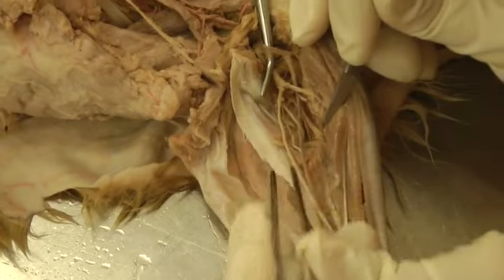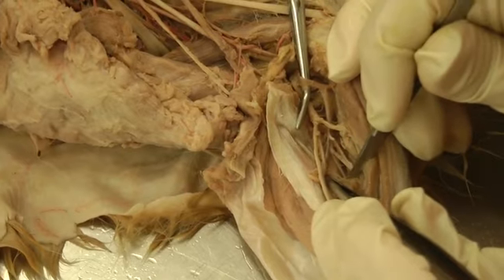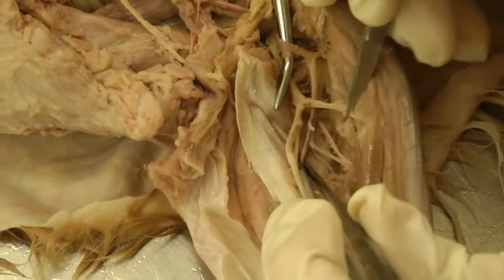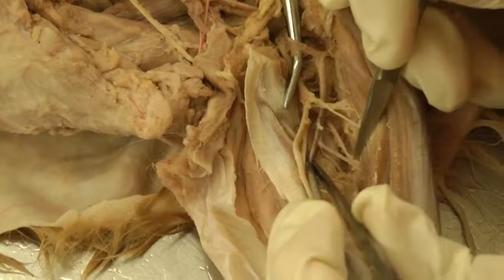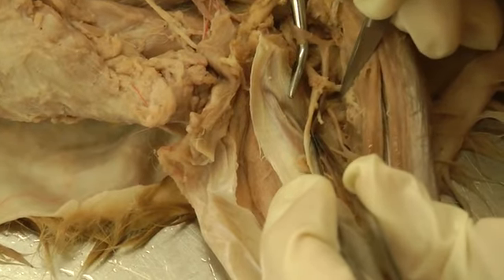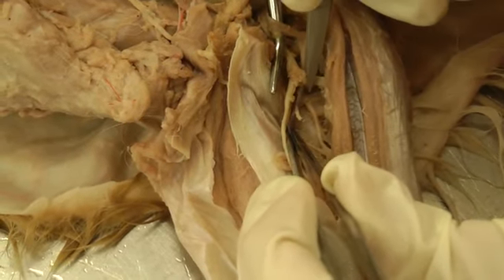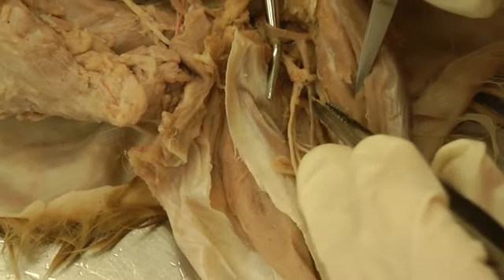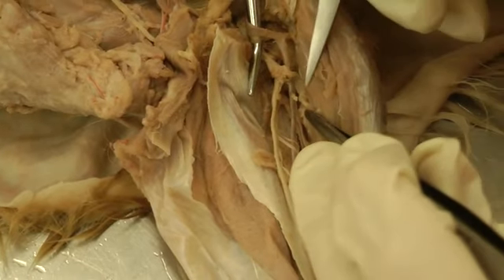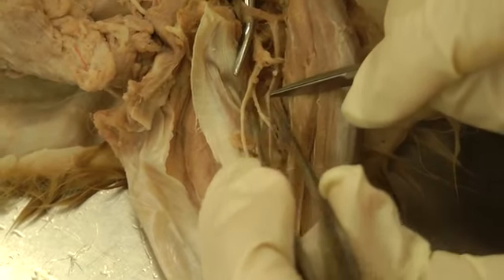The best way in the cat — especially if you have injection — is to pull out part of the pronator quadratus muscle and look for the caudal interosseous running down in that groove between the bones. This is the caudal interosseous right there. Moving a bit more proximal, here is the cranial interosseous — that's the one that just dives down and disappears between the bones. The deep antebrachial was right there, though in the cat you can't always count on the branching pattern being correct.